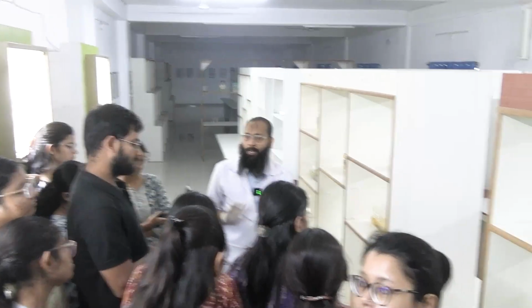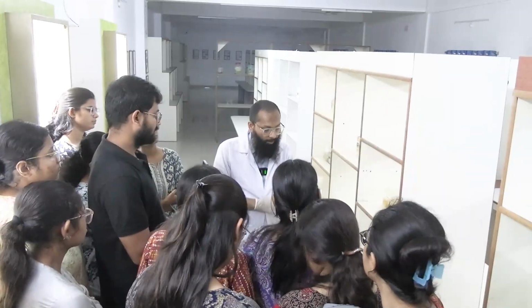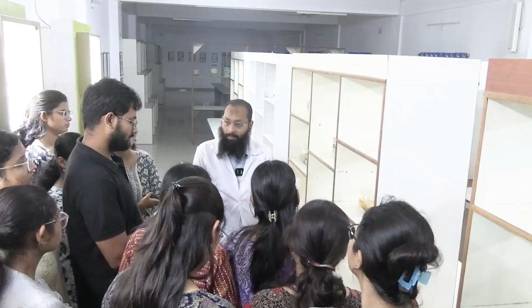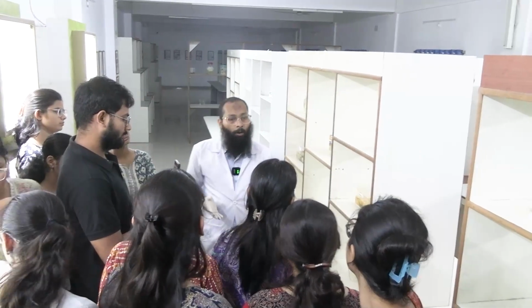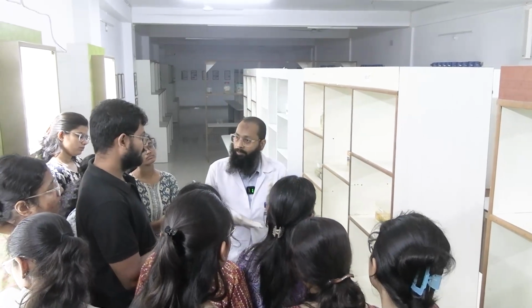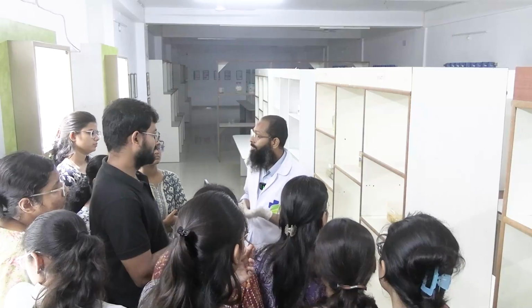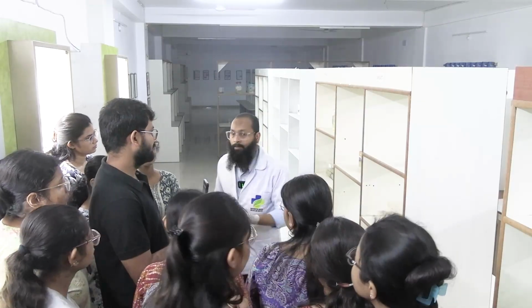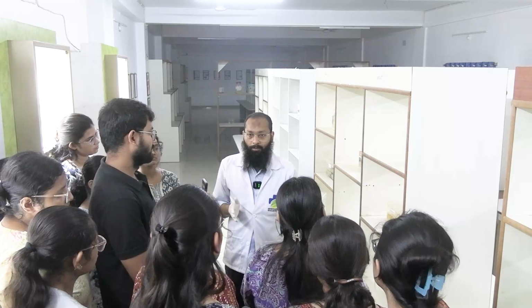The most appropriate way, which is not possible at your level because you are not getting the specimen in your hands, is that we first look for the laterality. How do we look for it? We consult the surgeon who has done the operation, then we go for the reports done before operation.